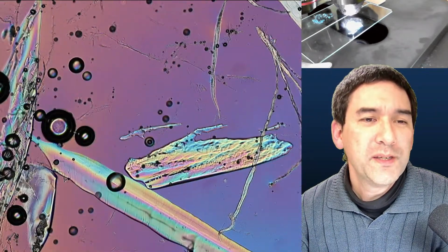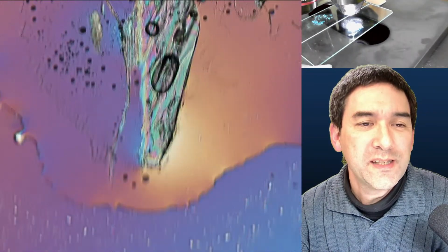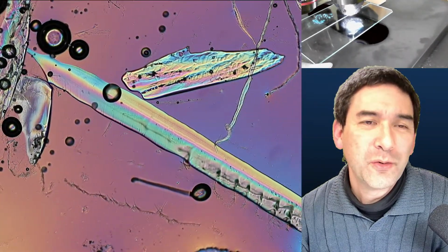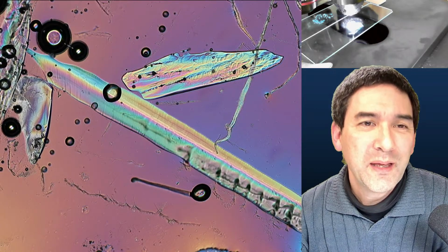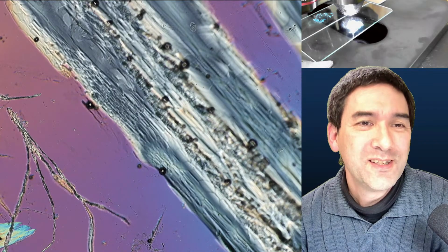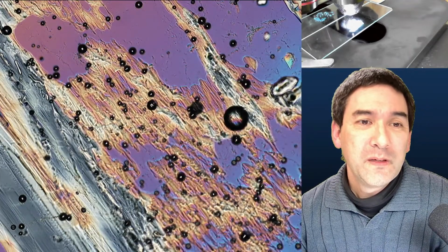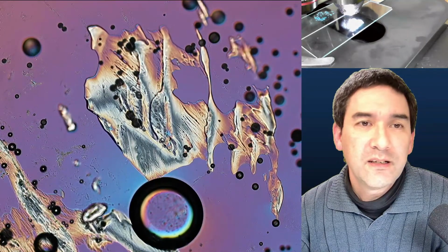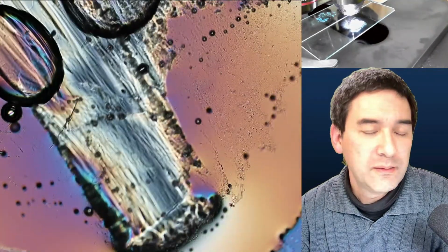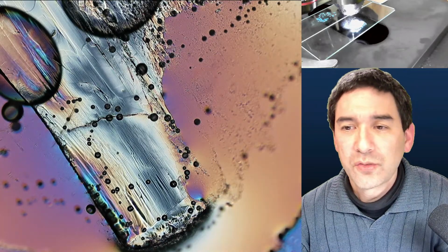Those here are a little bit improvised now, but if you want to see really nice crystals, some weeks ago I made a video about soy sauce. I put some soy sauce under the microscope, allowed it to dry up, and this made very, very nice crystals. Just check it out, it was a few weeks ago on this channel. It's quite interesting to see how the different conditions, like the concentration and also temperature, impact the appearance of the crystals as well.